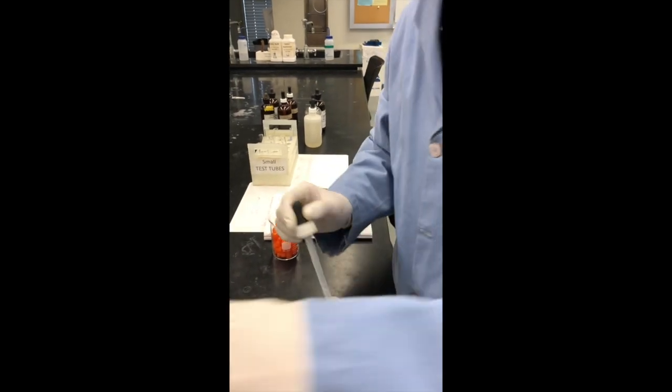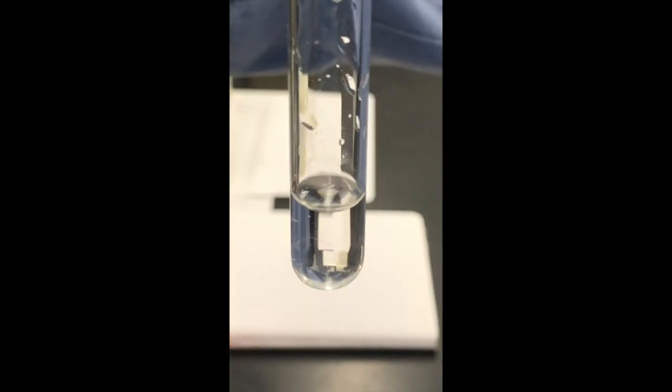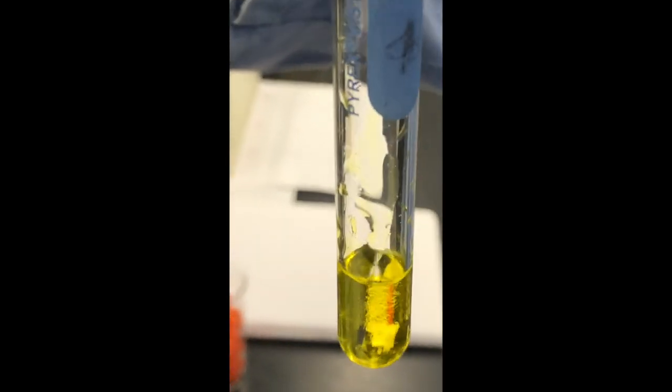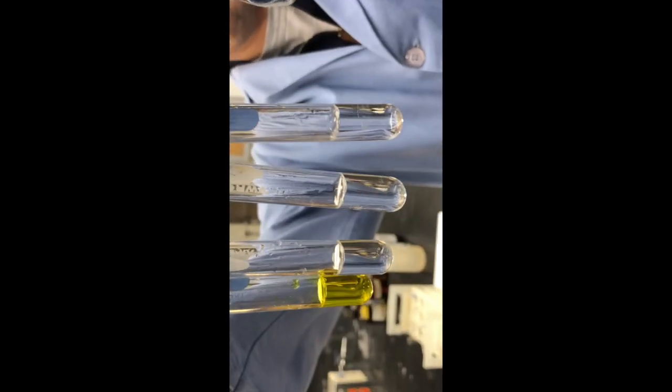When it's shaken up, the clear precipitate disappeared just slightly. Next, we have magnesium with ammonium oxalate, and finally with the acidic potassium chromate. Examining all four together: magnesium ion with sulfate on top, then carbonate where there was a slight precipitate that formed, and then oxalate and chromate.